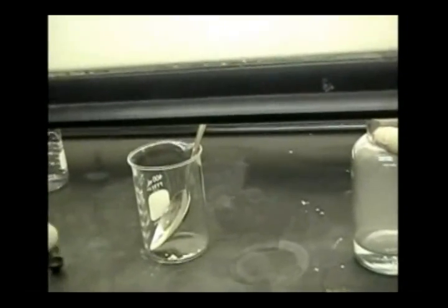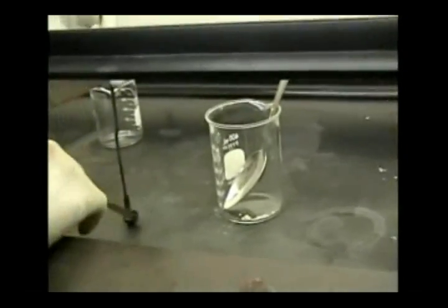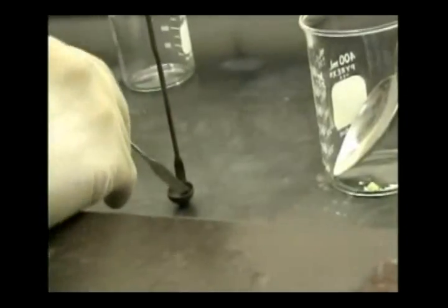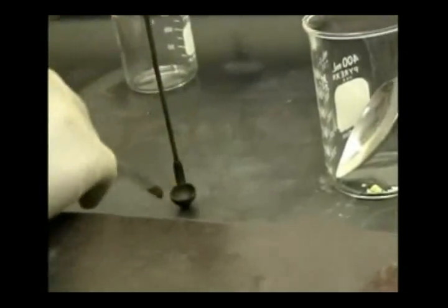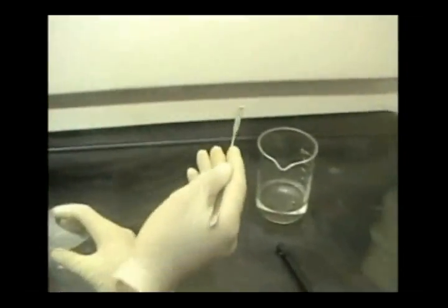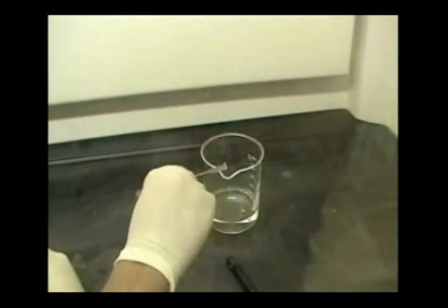Now we are removing the sulfur from the deflagrating spoon and disposing the sulfur into a waste container.